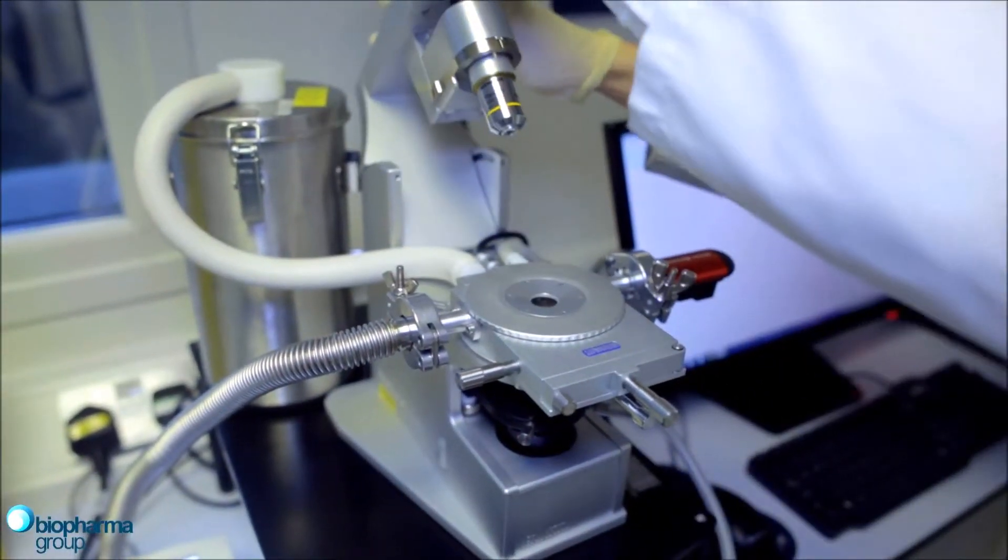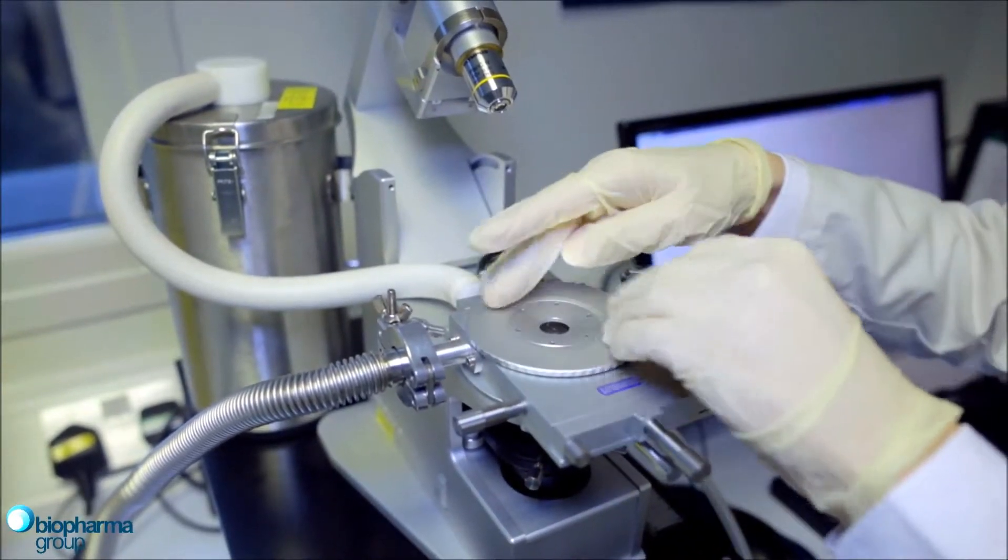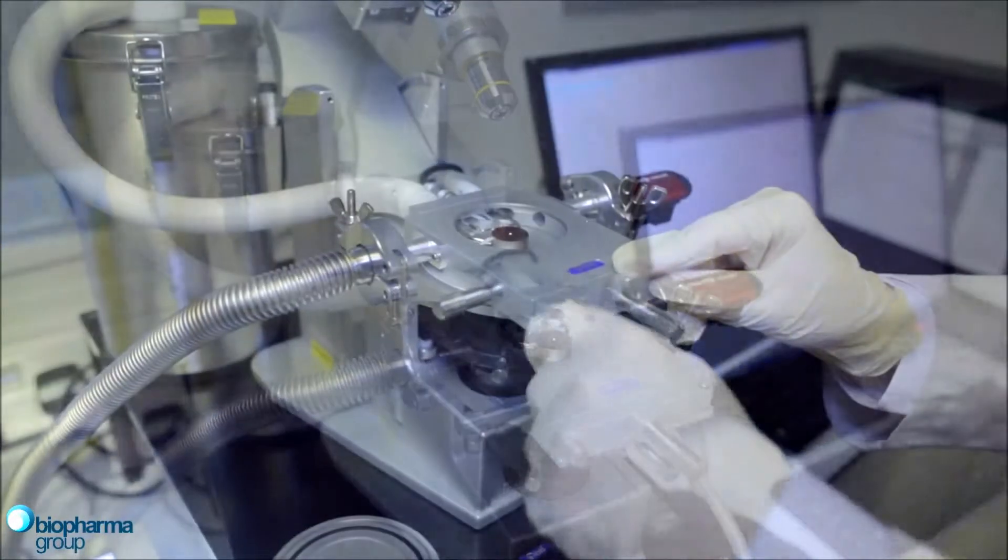To begin, we'll need to move the optics out of the way so that we can gain access to the sample. Then we'll need to unscrew the stage window and place it to one side.